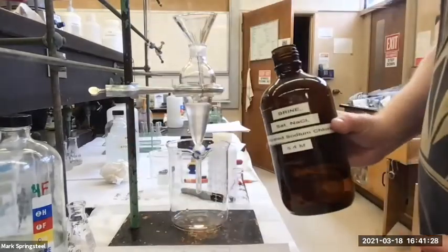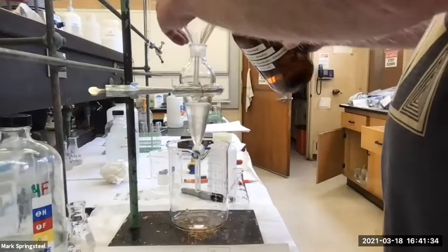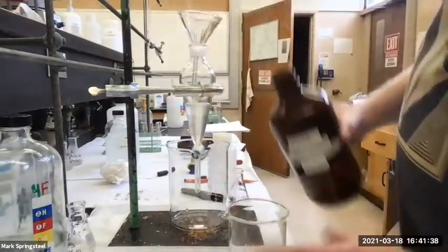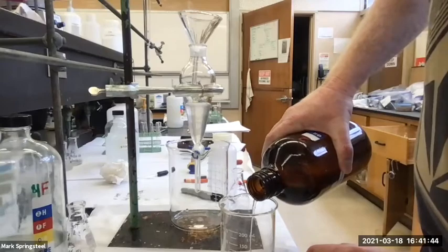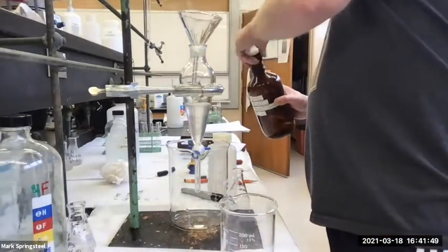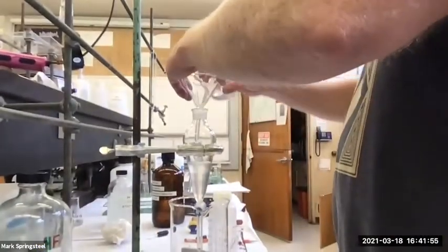So with the brine, I usually add about the same volume you already have, or half as much. It's approximate. Actually, I'll measure it out. Usually I would just pour it in with experience. You kind of get the feel for this stuff. But let's go about 20 milliliters, maybe 25 milliliters. That sounds good. Pour this in.